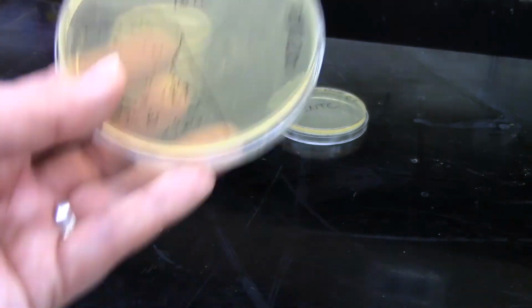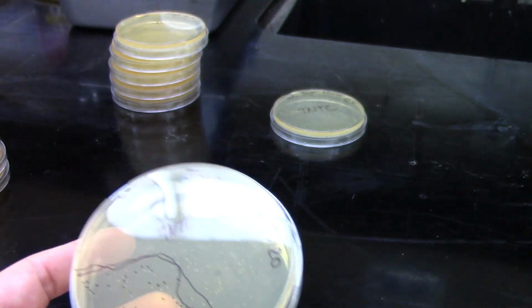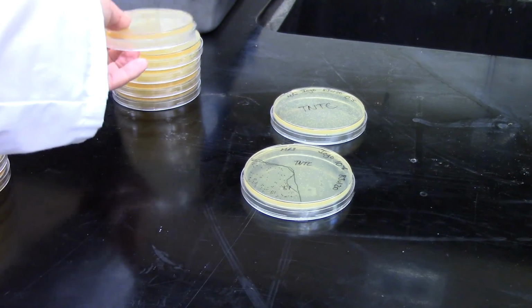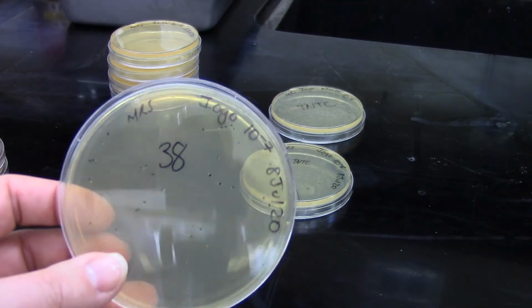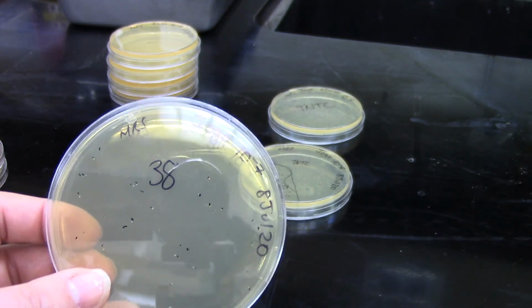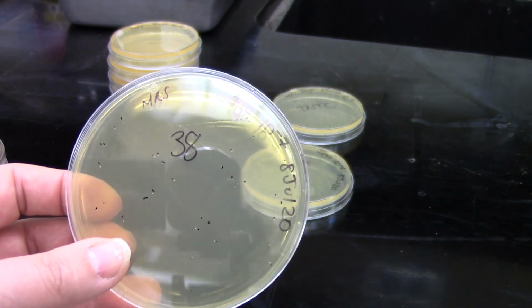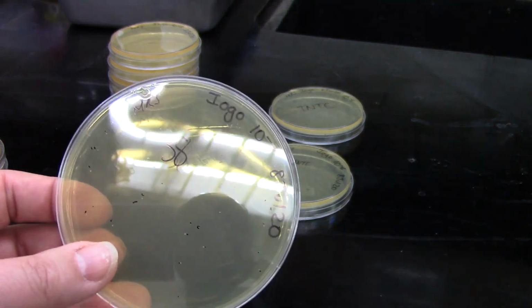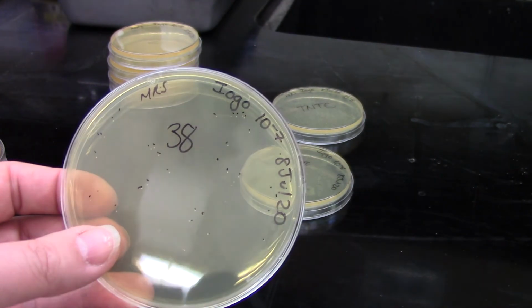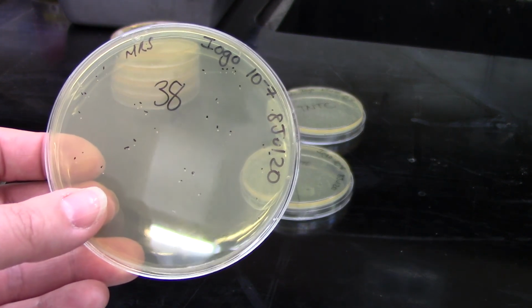And I'm totally okay with that because I also counted the next sample, so the slightly more dilute sample, and I found that I got 38 colonies on that one. So that is right in the range that I want to be able to use for my data. So I'm quite happy with that and not at all worried that the less dilute sample was too numerous to count. So I'm just going to continue to count these colonies, and I will get you guys a data set that you can work with for your assignment.